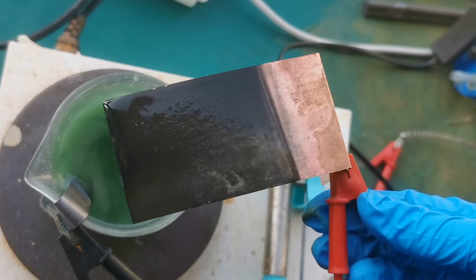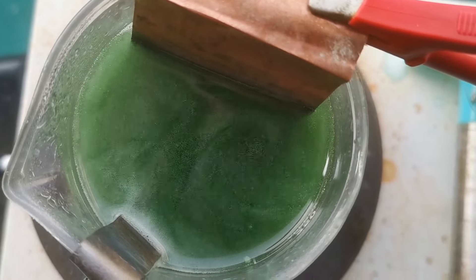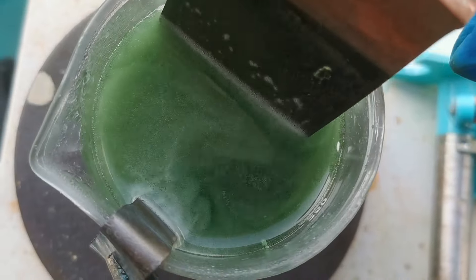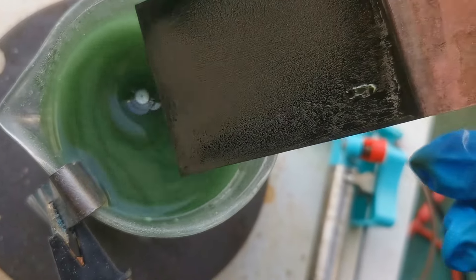There are small particles of nickel sticking on the surface that scatter light and make the coating look dull. 10 minutes later, a new type of nickel deposit lighter in color had formed on the surface. I'm not sure if this is a layer of shiny nickel or just some oxide junk, so I decided to leave it plating for some more time.